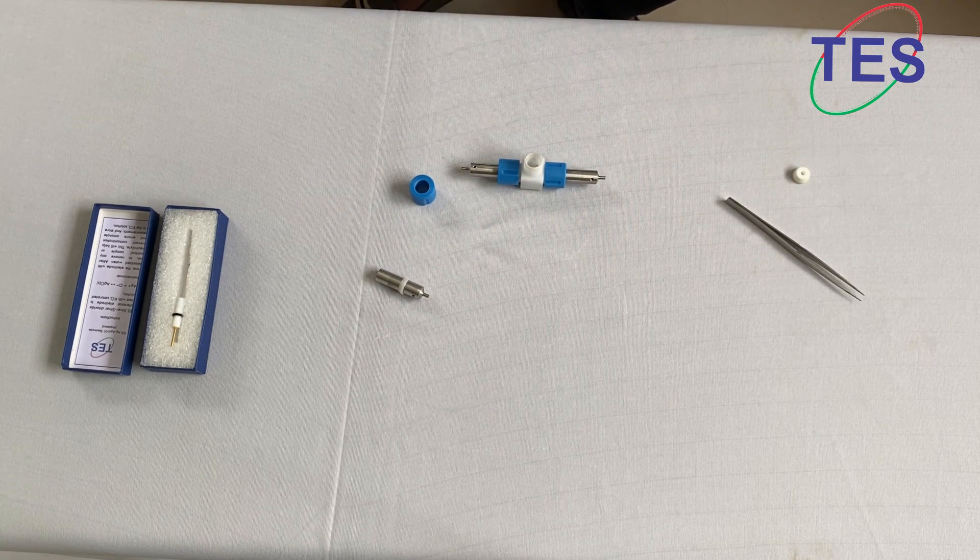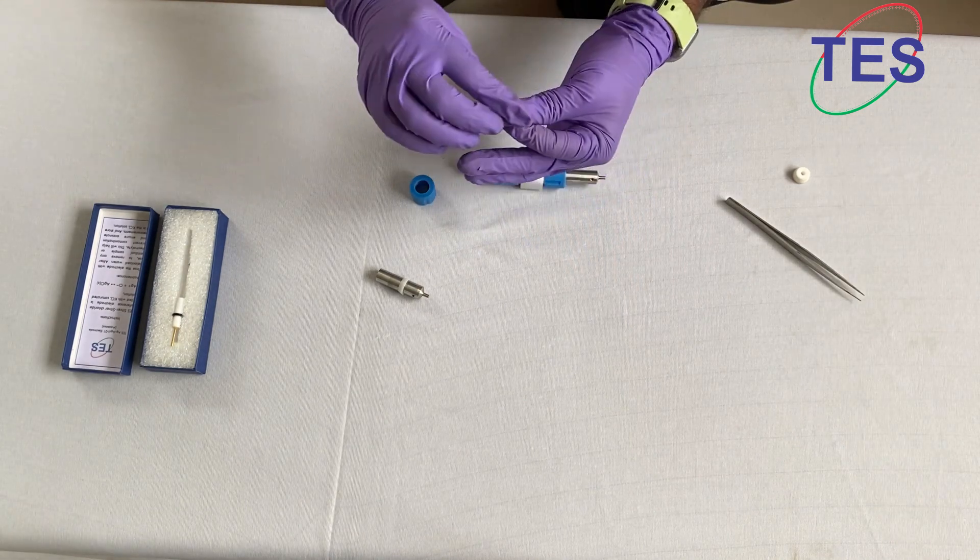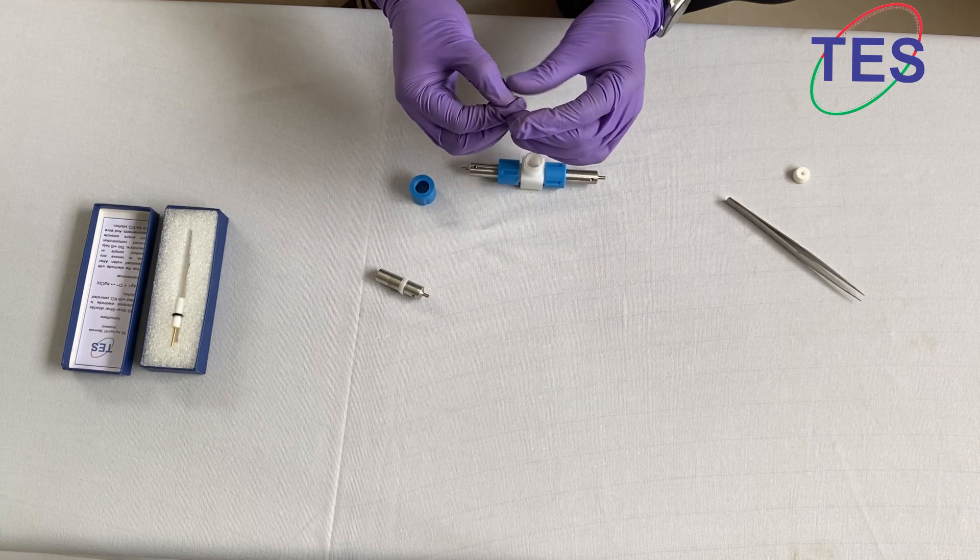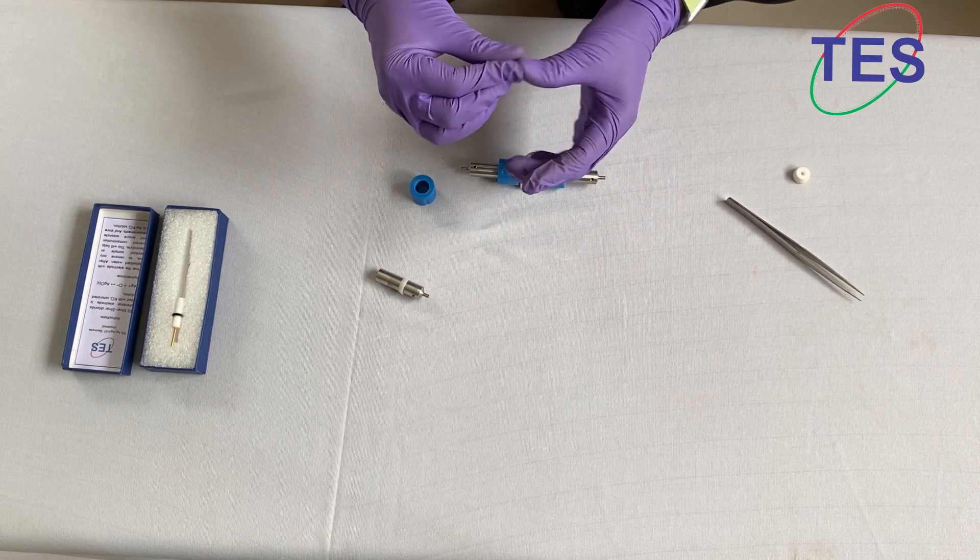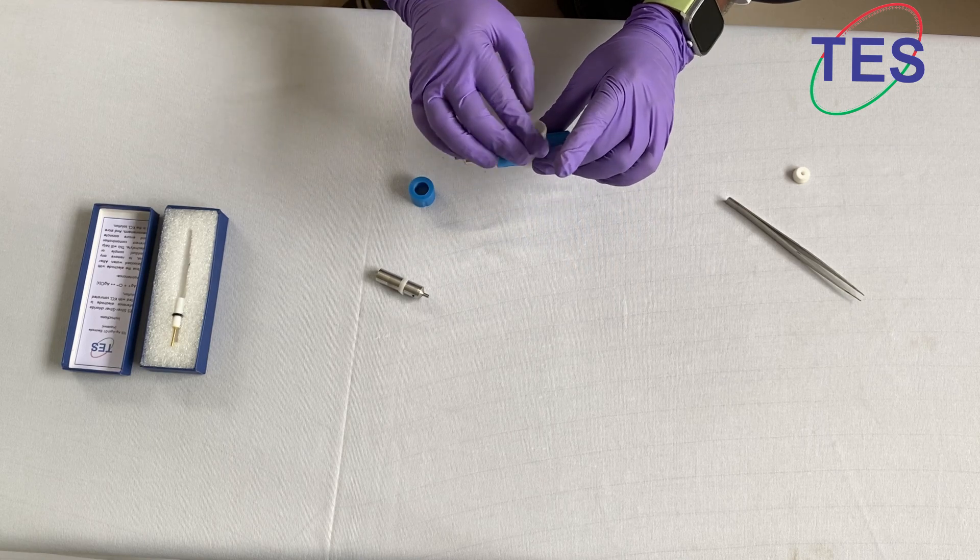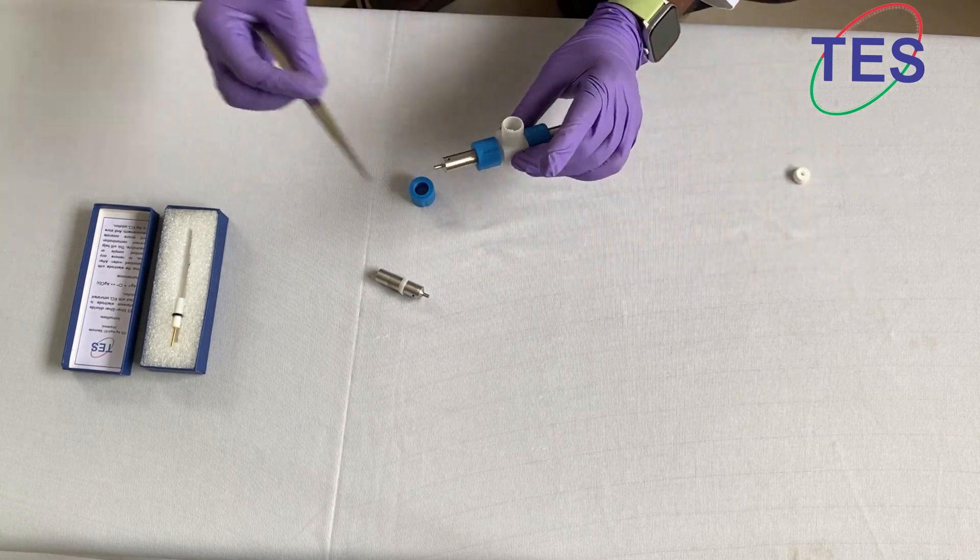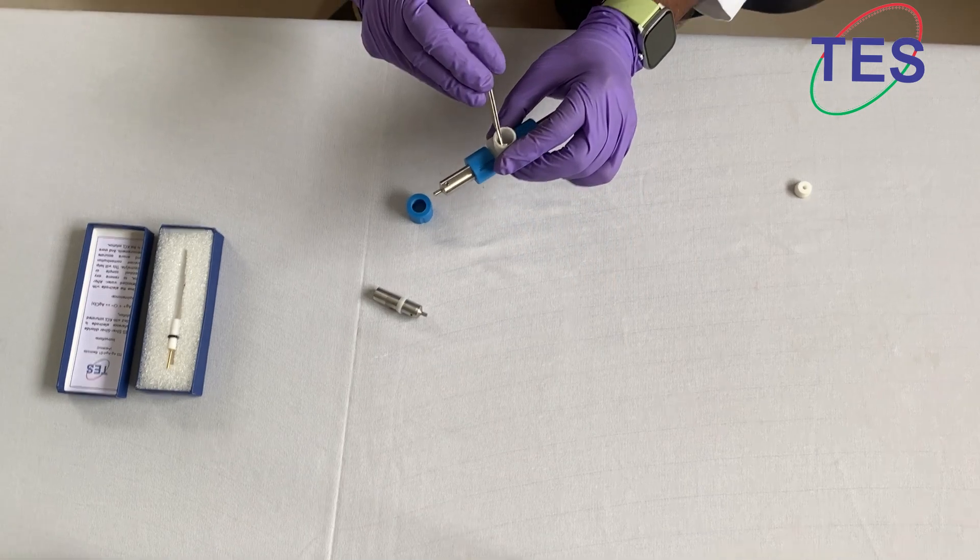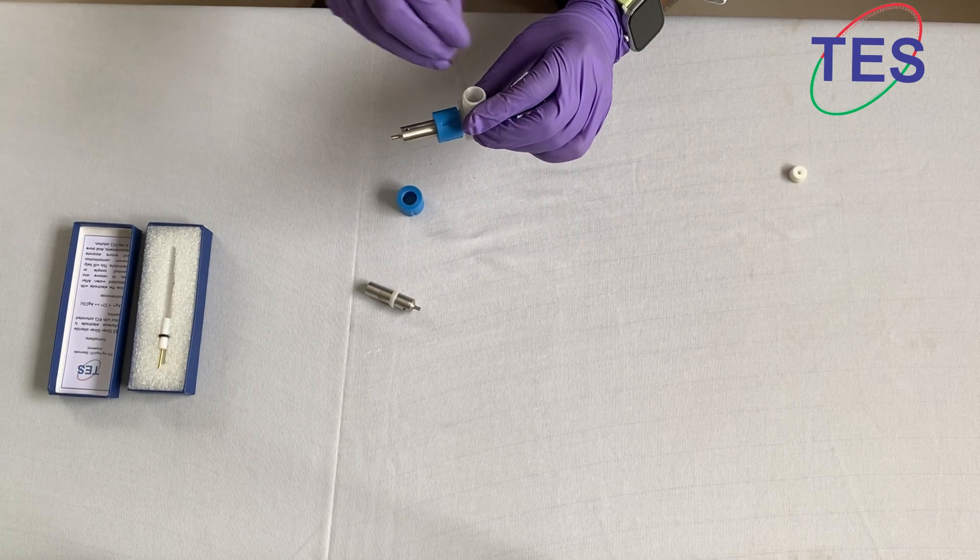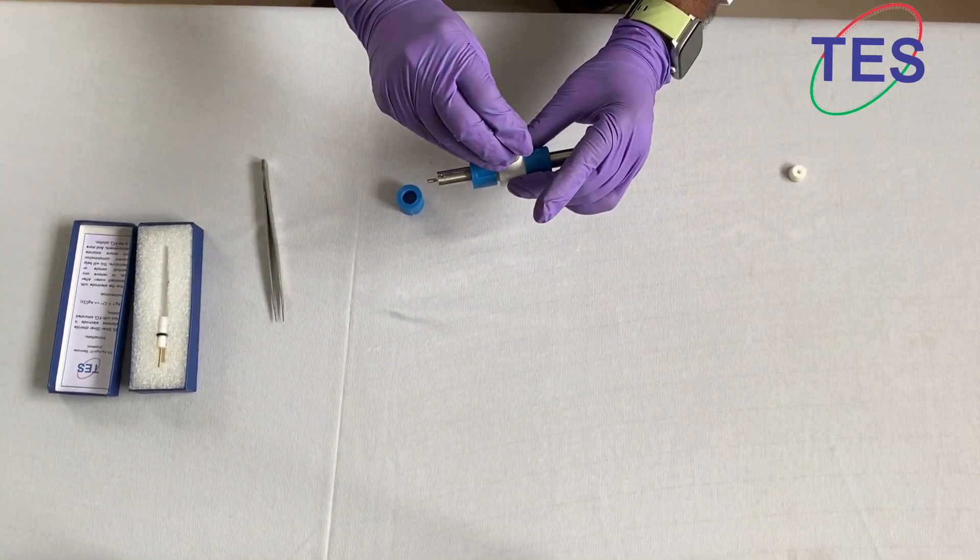If you want to take another connection, please take a small separator material, make it like this and put it inside the hole. Make sure that it touches your reference electrode and insert it.